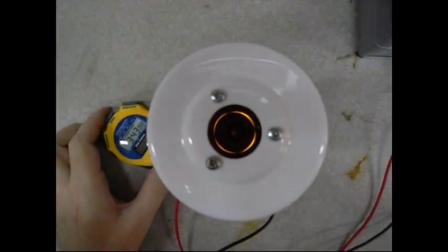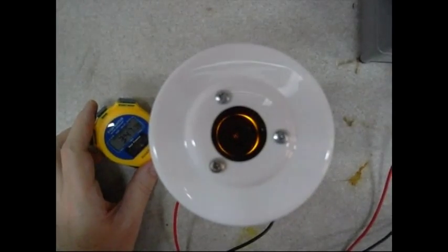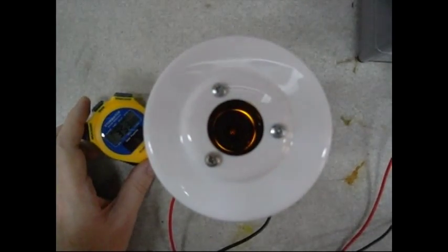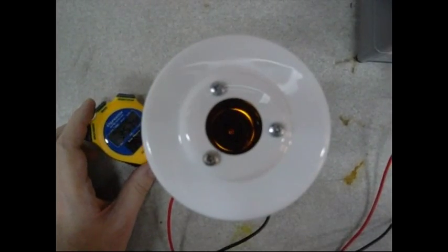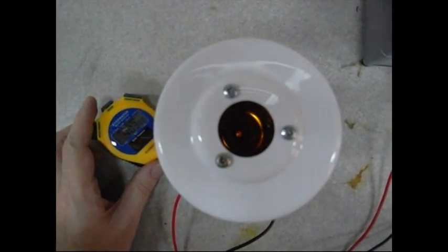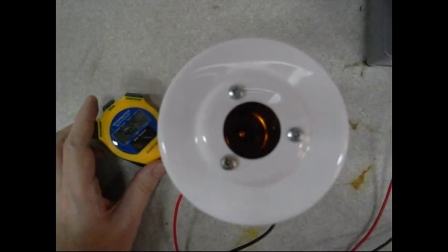In the next 40 seconds, we start to see some light coming through the polarimeter as the hydrolysis proceeds, and the products of the hydrolysis reaction have different optical rotations to the sucrose starting mixture.